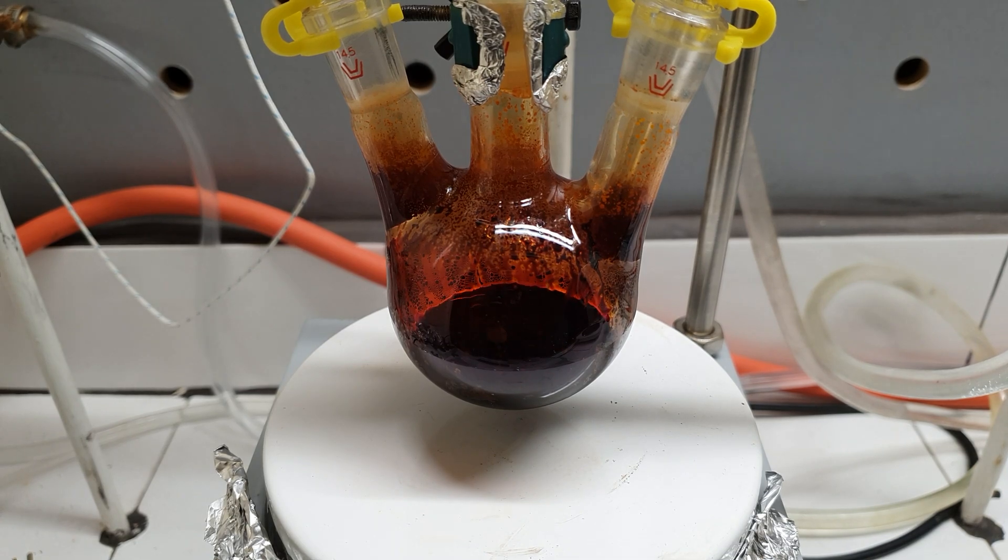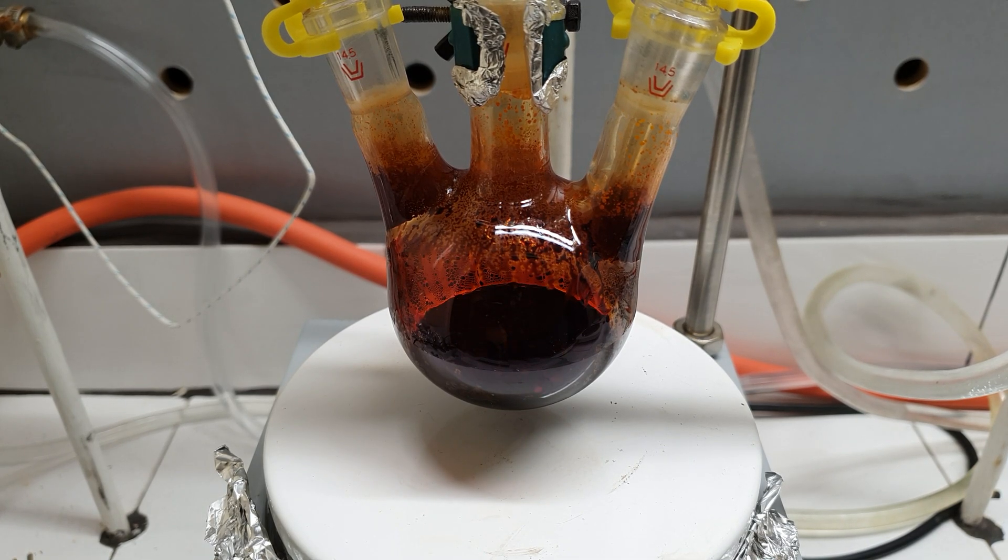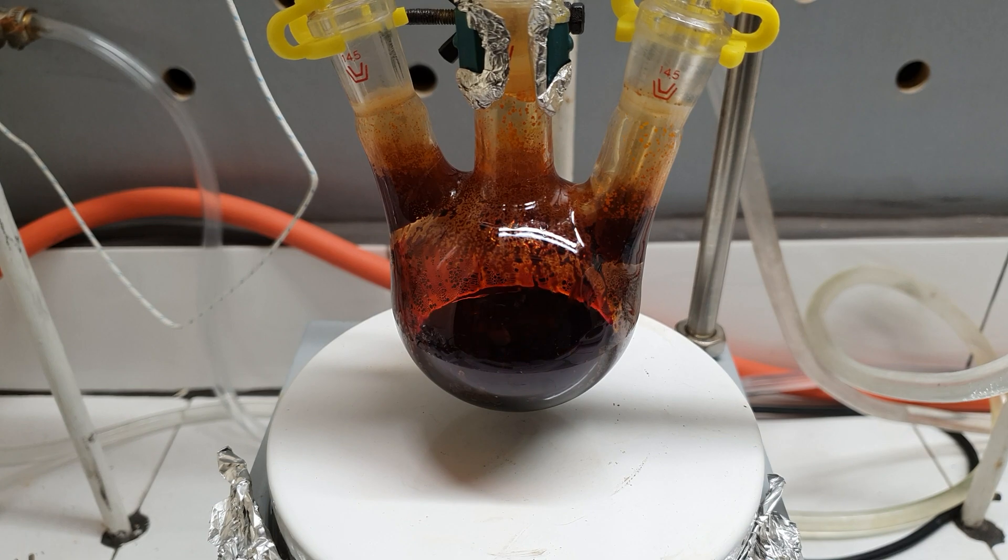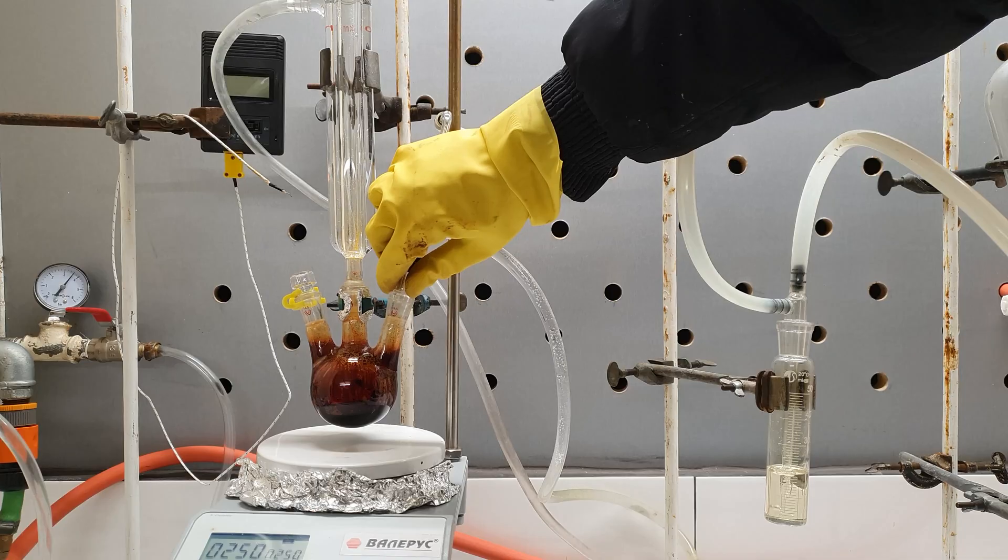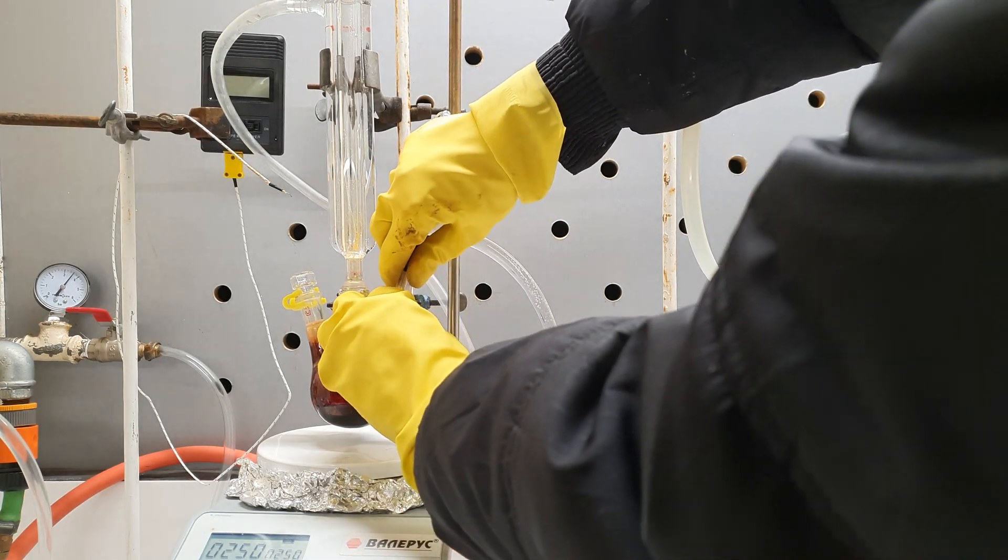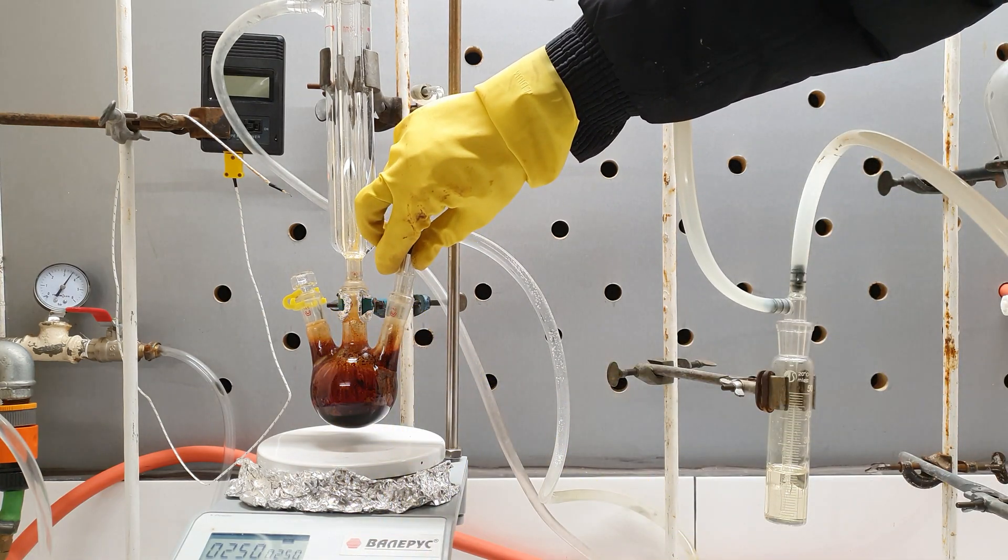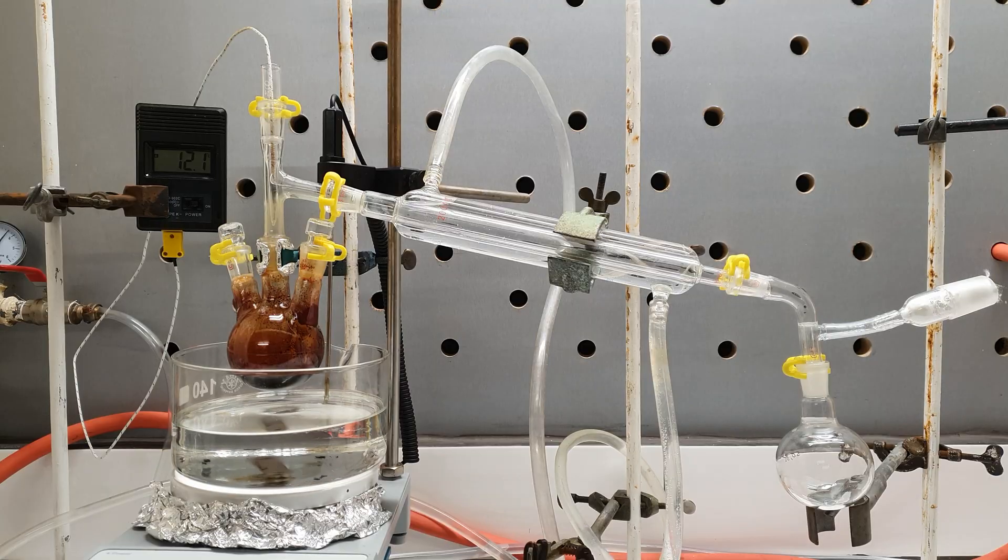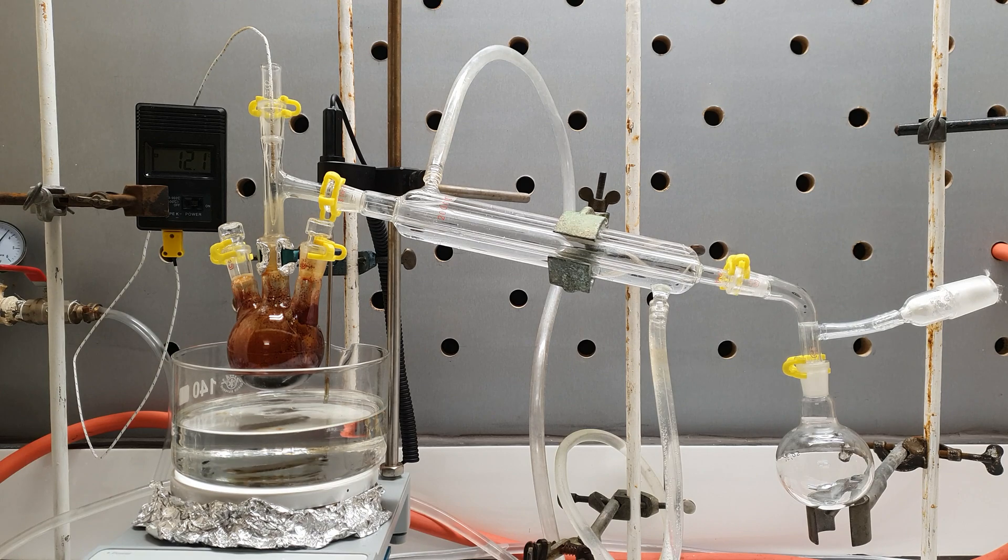In the end of the reaction, the temperature of the flask was so cold that I was able to touch it without burning myself. When no more chlorine was produced, I disconnected the inlet tube from the flask. Then I arranged the flask for simple distillation.